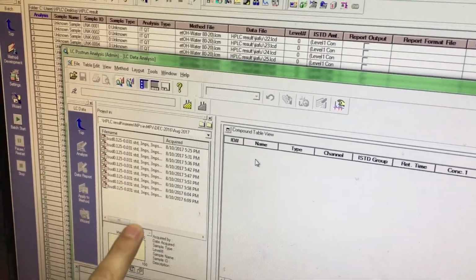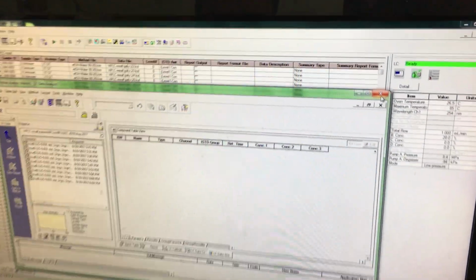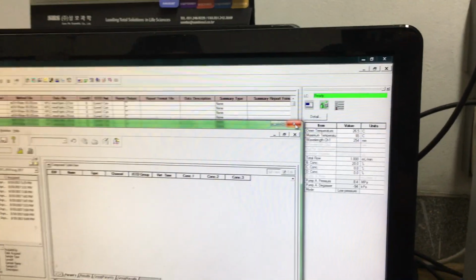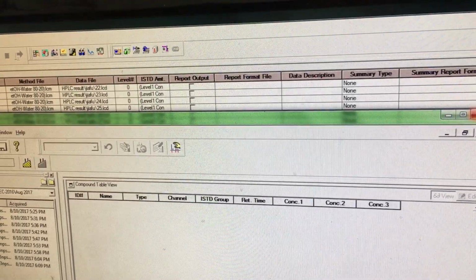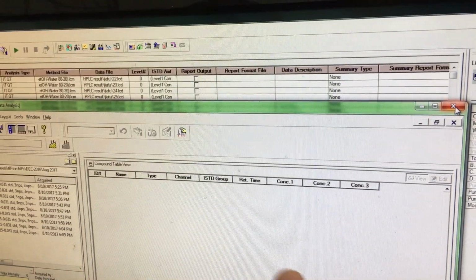Last time this kind of 100 samples came, and anyway there is some other system to evaluate your result. Now I have one question about concentration. Here are concentration 1, 2, 3. So now you have already put the samples, you made the concentration already around 20. Does the system make the concentration automatically, or do we have to? No, you are numbering, you should know. So you mean each time we cannot check different concentrations at one time? They don't arrange; we have to put the concentration. No, this is a very advanced method. You can click concentration 1 is 125 and concentration 5. In the standard you can put it, then for the remaining samples they can give the result automatically also. But this system is a little advanced, and honestly I don't know this method.